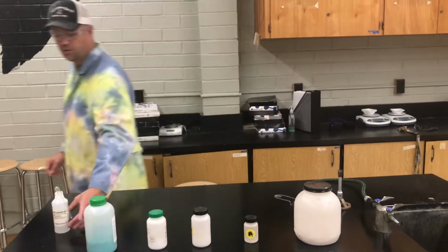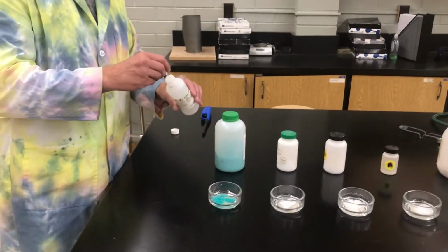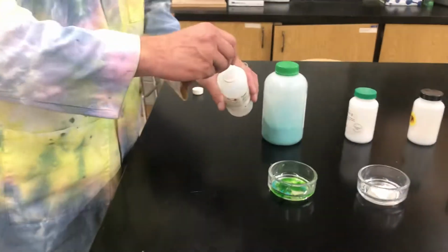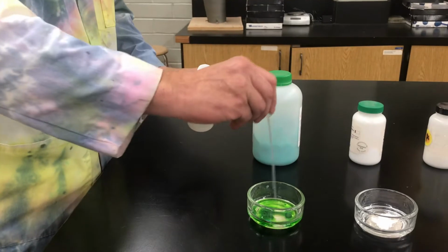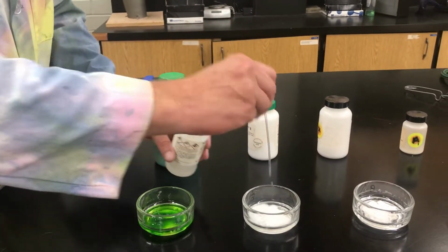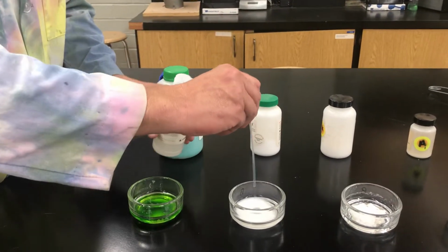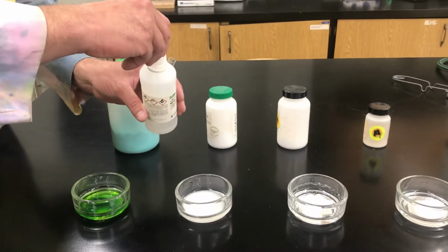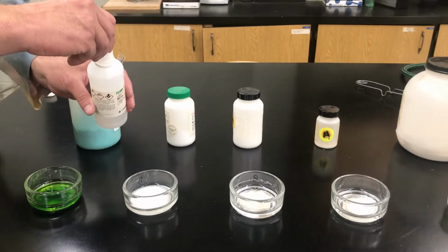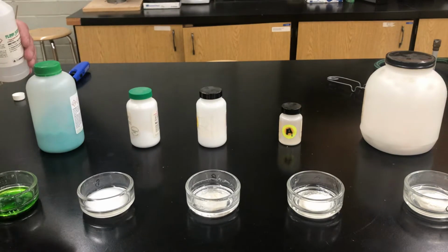So the first thing I'm going to do is add some methanol. And this is basically just our agent to heat it up enough that we can see this happen, okay? But not so much that it actually starts to burn and react with the oxygen in the air. So each one of these is going to get a couple of squirts of methanol. I'm putting it in the lithium salt right now. And we're going to light the alcohol that's in here on fire, just so that it will energize.